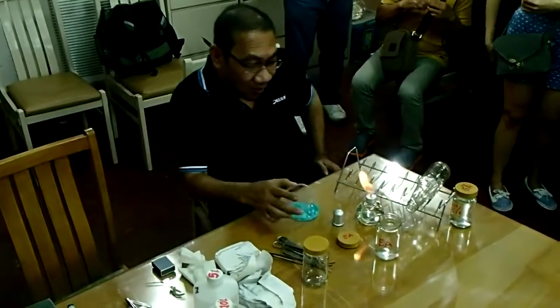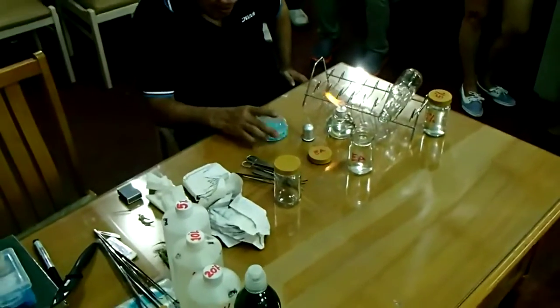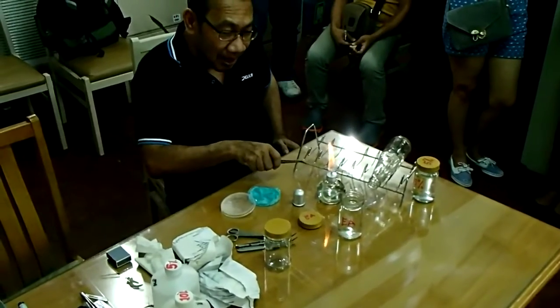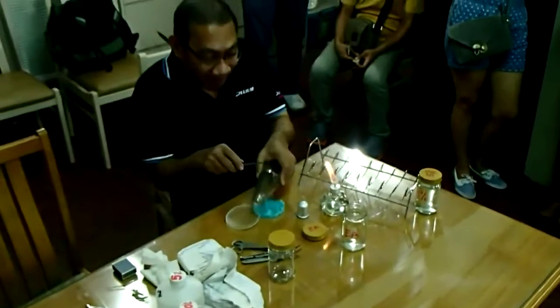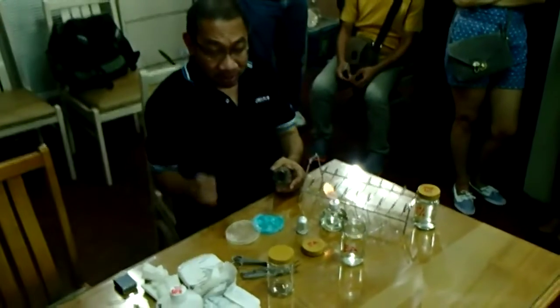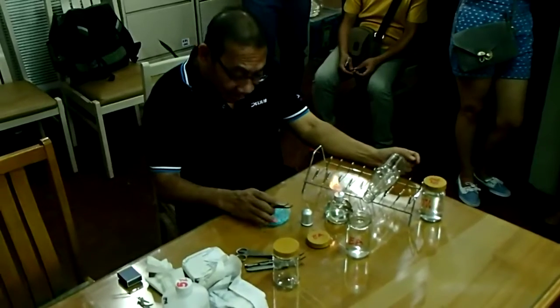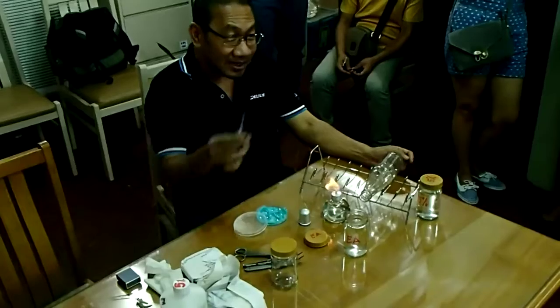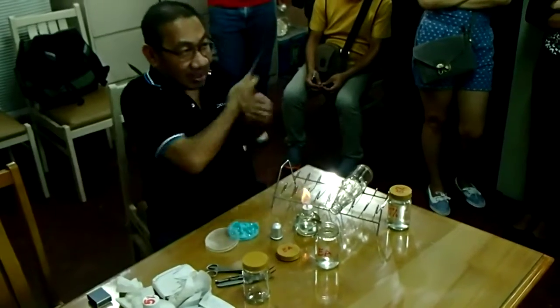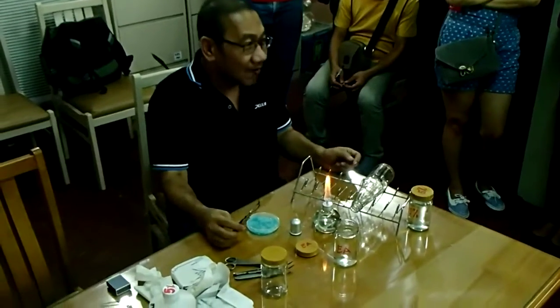When you open the petri dish, don't leave it open unnecessarily for long. Once opened, cover it again right away. And when it's open, your hand should not pass over it, and the bottle should not pass over it either. If something falls in there, it will contaminate. So the open surface — it's best to keep it covered. Nothing should pass over it — not even your hand, because a lot of things can stick to that.